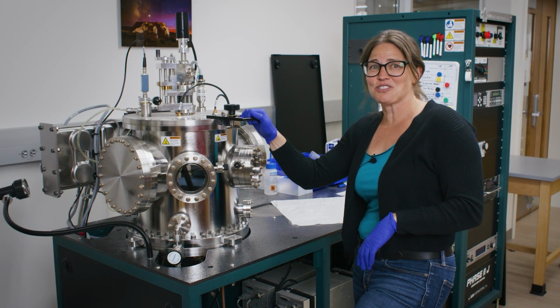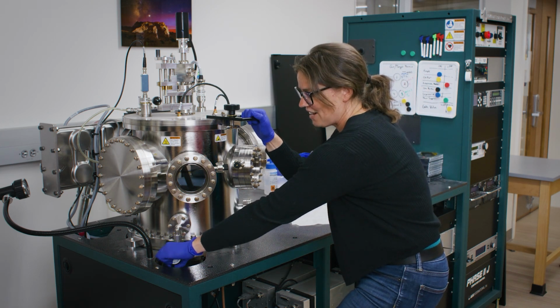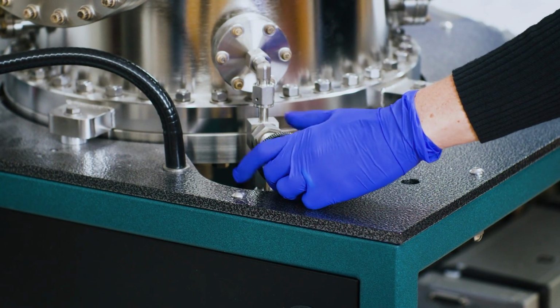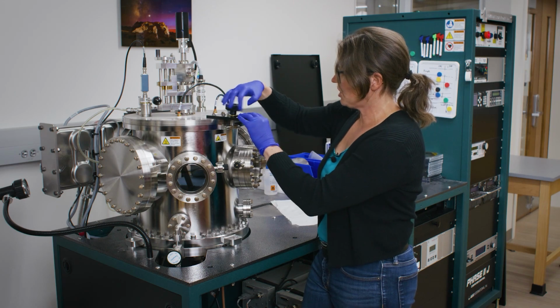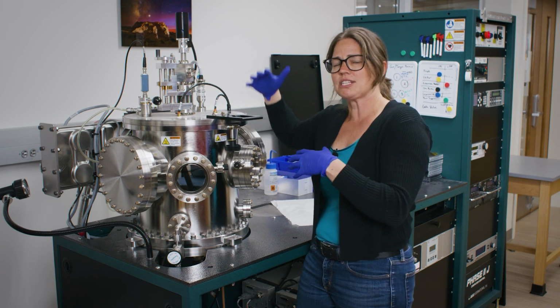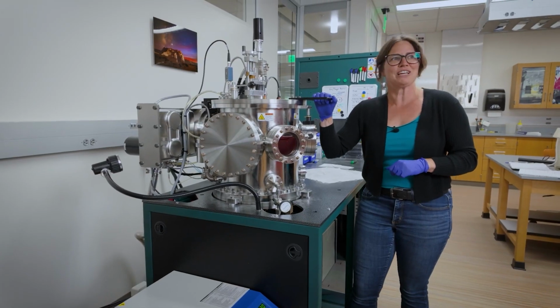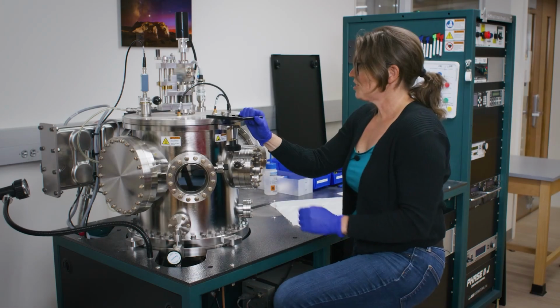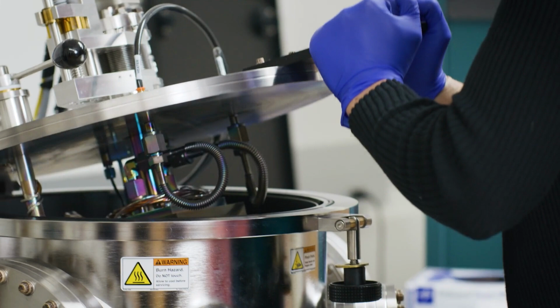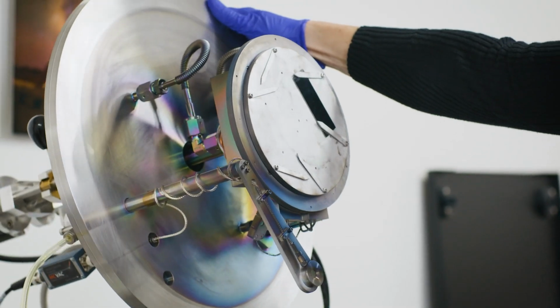Okay, now that the turbo pump controller has gone dark, we can go ahead and open our vent valve on our chamber to finish the job to get us back up to atmospheric pressure. In order to open the chamber, we can also go ahead and undo the knob on the top of the chamber, and this will allow us to actually open the door once we're at atmosphere, which we are still not, so we wait just a little bit longer. Okay, so now we've come up to atmosphere and I can go ahead and open the chamber. So I will go ahead and open it up and we can take a look at what we've deposited.